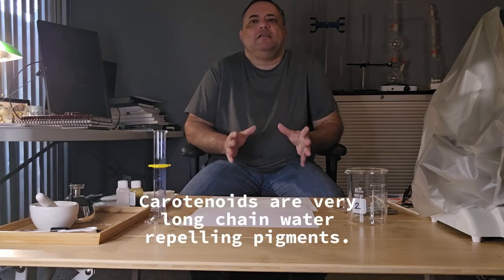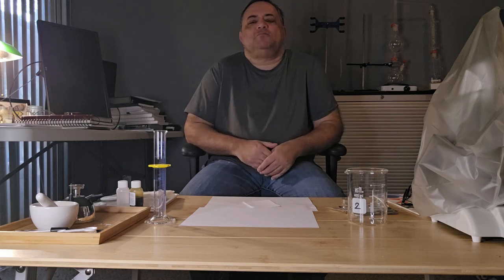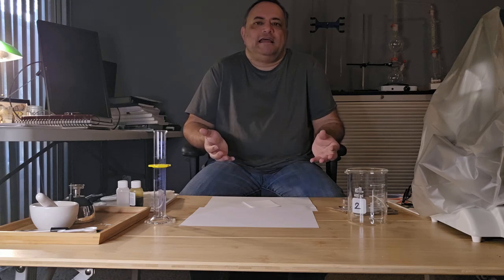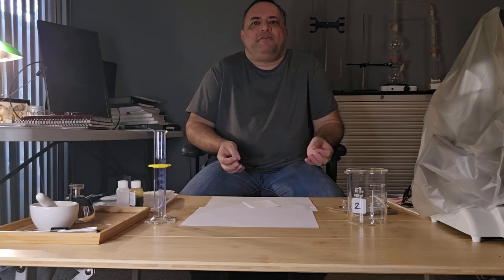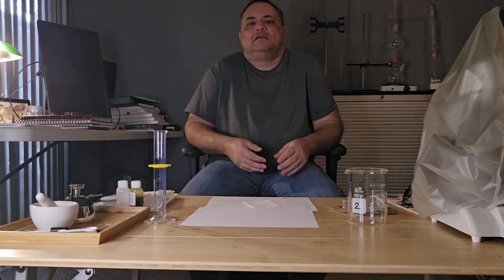Carotenoids are very long-chain water-repelling pigments, and they are synthesized in the plastids of plant cells. And they are responsible for producing the bright, beautiful yellow and orange colors of plants and flowers. And we're going to look at xanthophyll, which is a type of carotenoid and is a pigment found in plants and is responsible for the yellow coloration in leaves, fruits, and flowers.